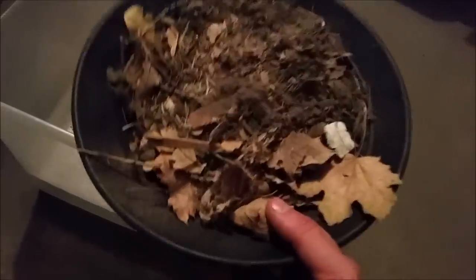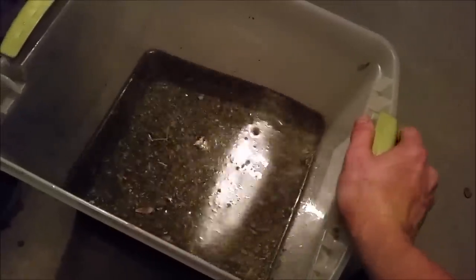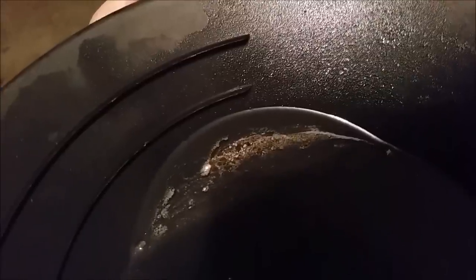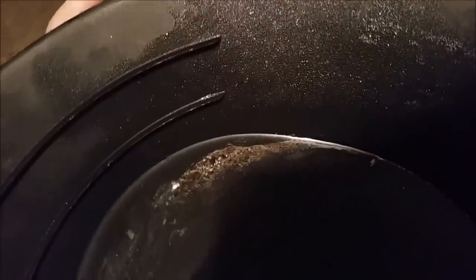Finally, I need to recover the mercury. Mercury is heavy and dense like gold, so I can recover it the same way I would gold in a stream — by panning. The waste water and dirt that gets panned out can probably safely be disposed of at the city landfill. If done correctly, you should be able to separate out even the finest droplets of mercury from the dirt. As you can see, I've got some zinc powder in there as well as some tiny droplets and a larger bit of mercury.